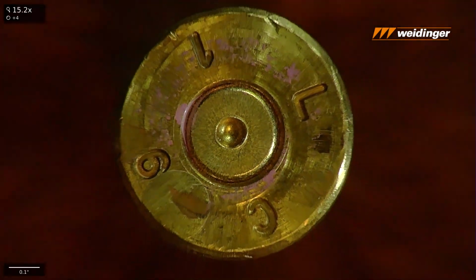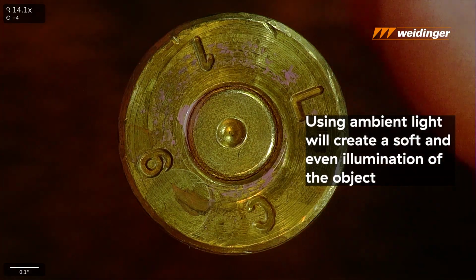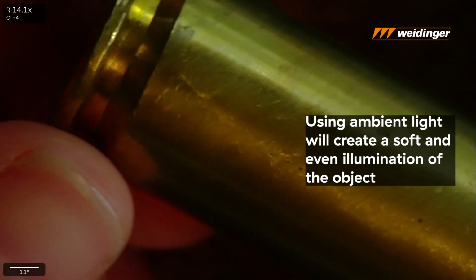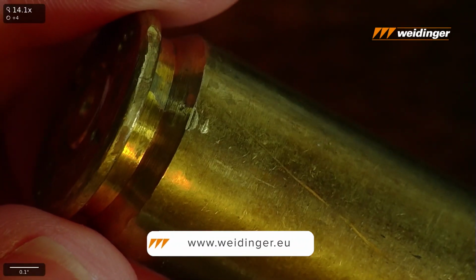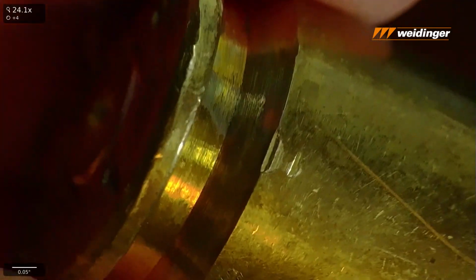Another thing you'll notice as I'm moving around is I'm not actually using the TAGARNO system's built-in light. I'm just using ambient light. So we get a little bit of noise, but what we end up getting is this very soft, even illumination from the room. In terms of illumination, we would almost call this global illumination.